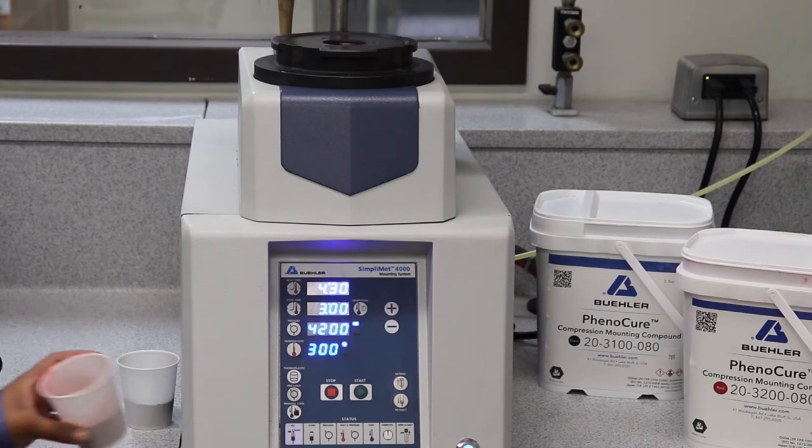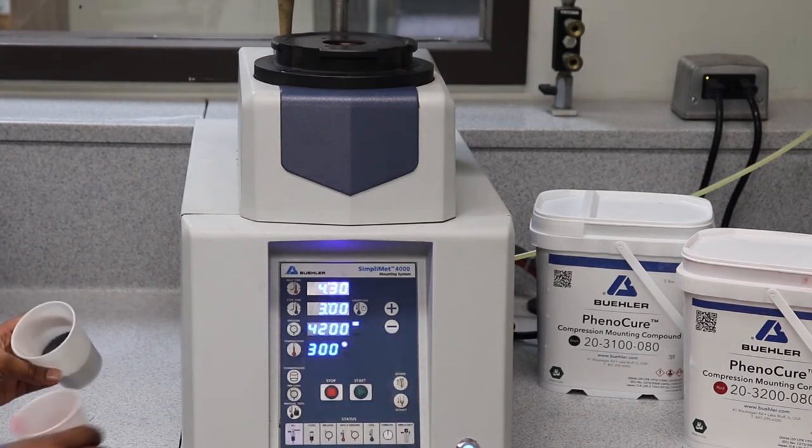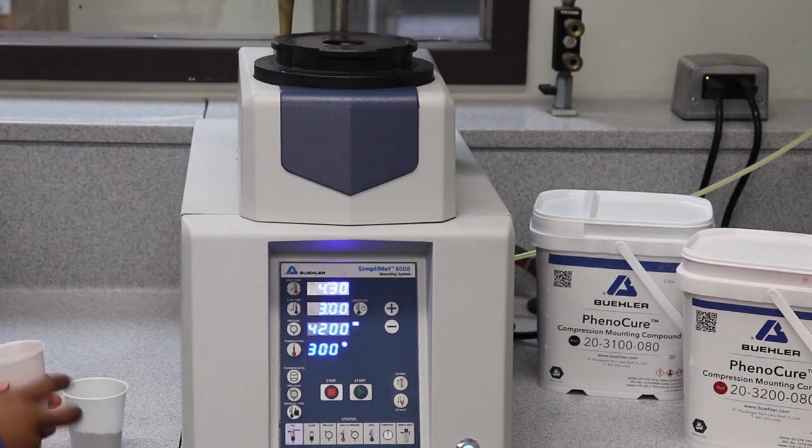I've already measured my mounting media. We're going to be using phenocure to mount the samples. The first sample I'm going to mount in black phenocure.